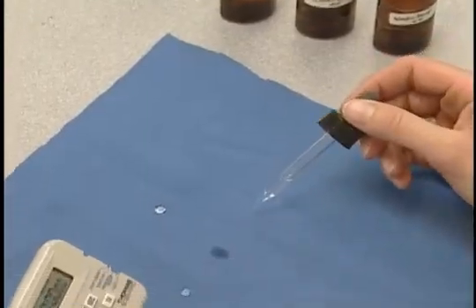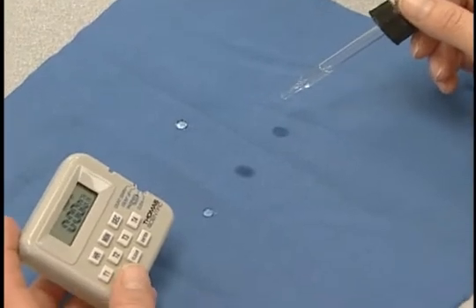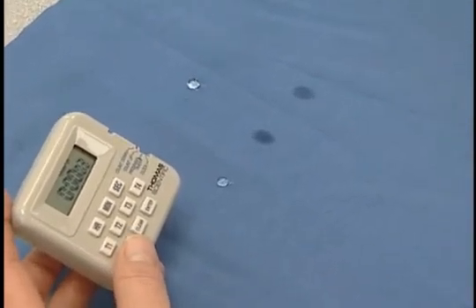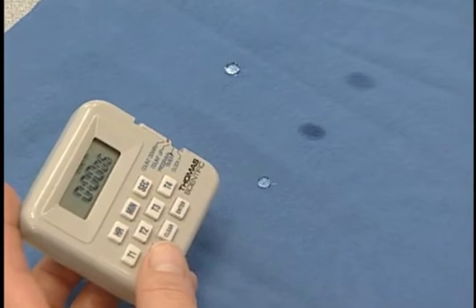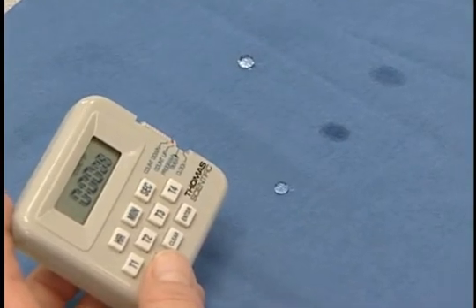This test method is most often used by chemical suppliers, fabric finishers, and research and development laboratories to judge the repellency success of their products.